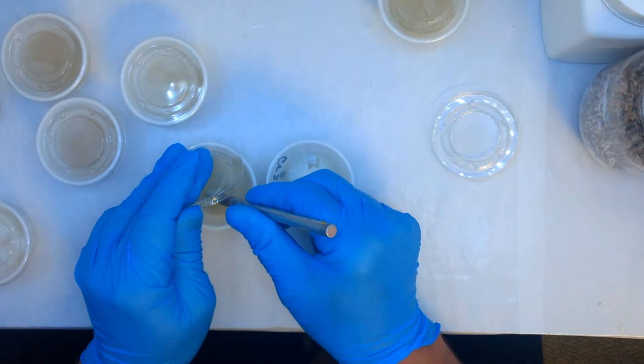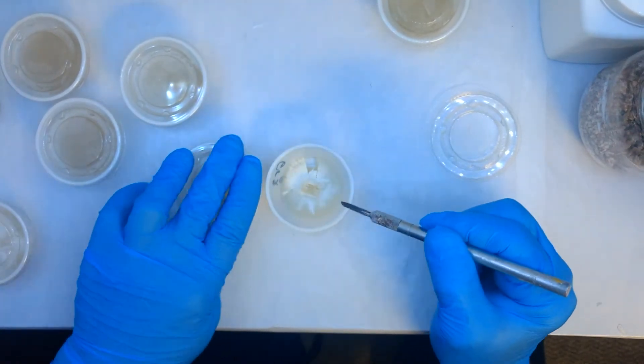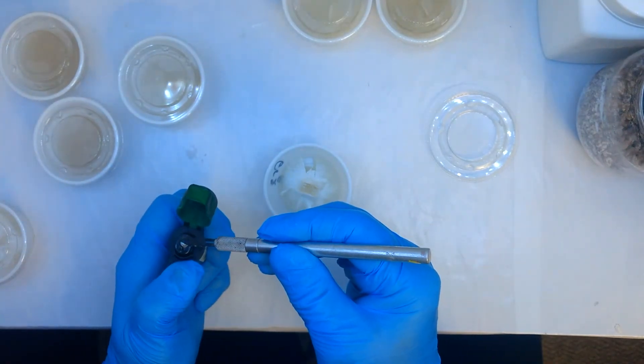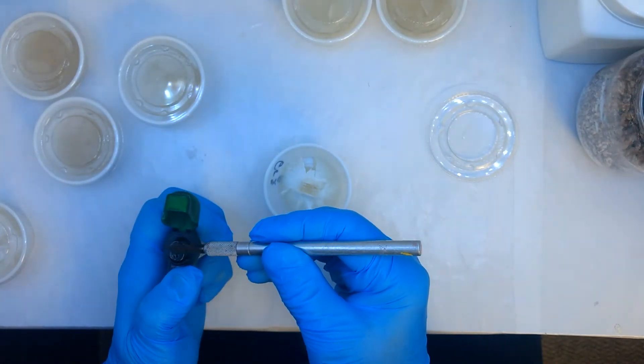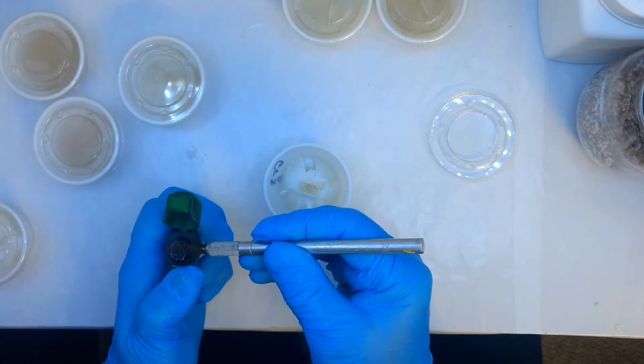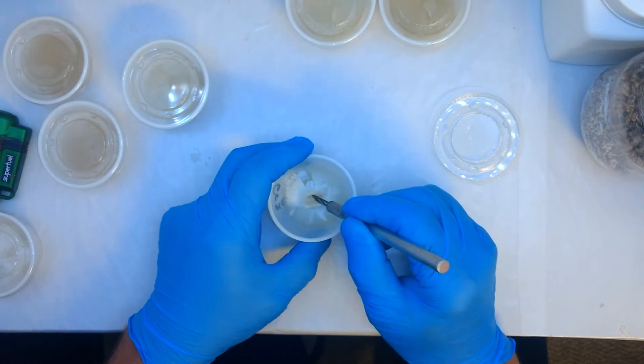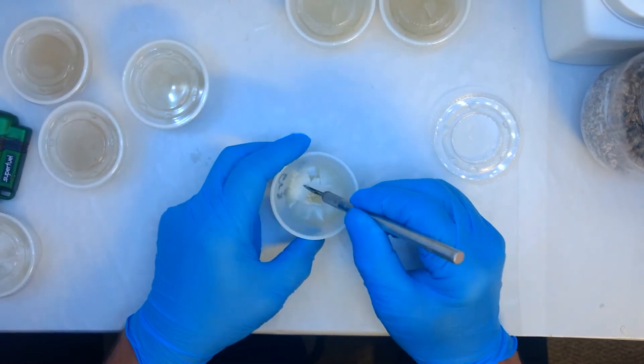Just remember when you're doing any kind of work to do it in front of the flow hood. I do most of my work in front of the flow hood.